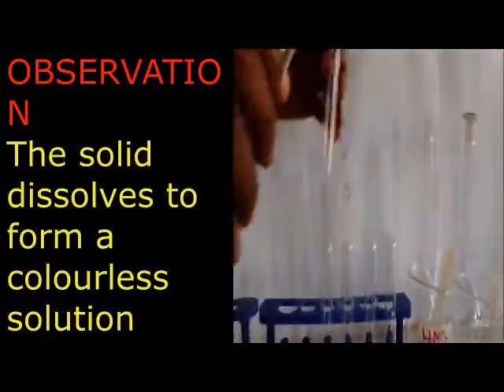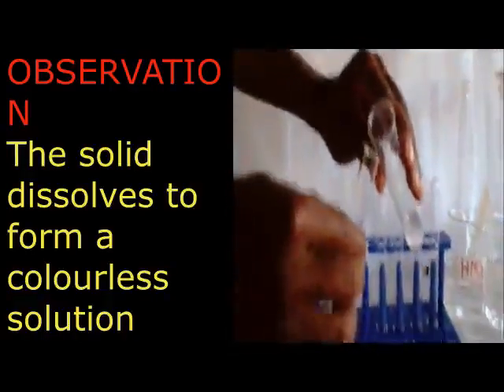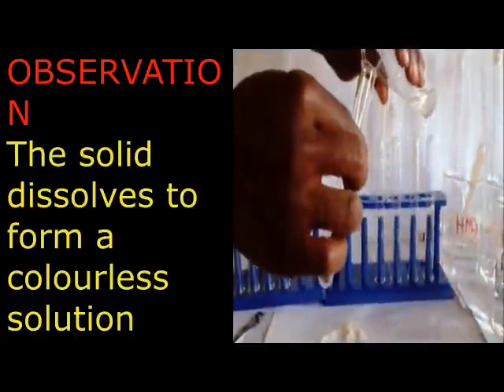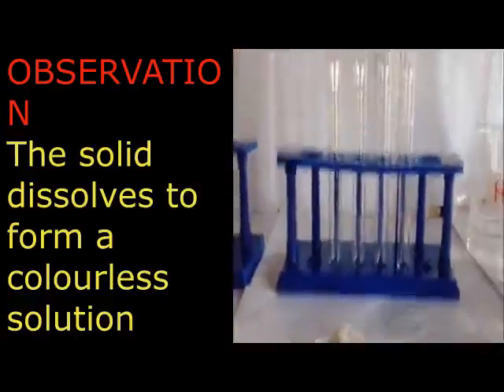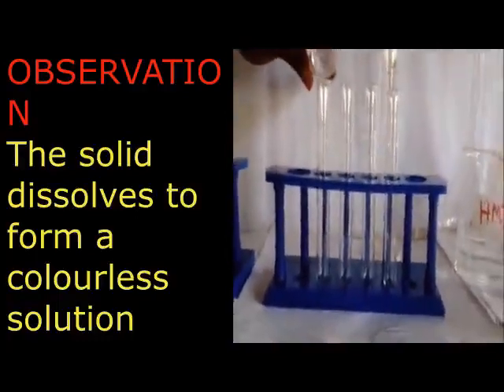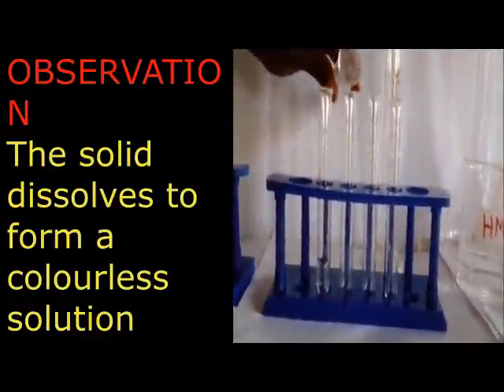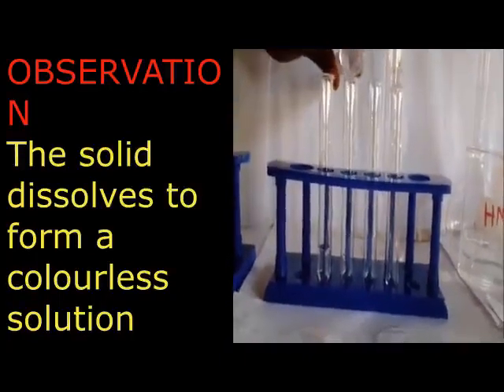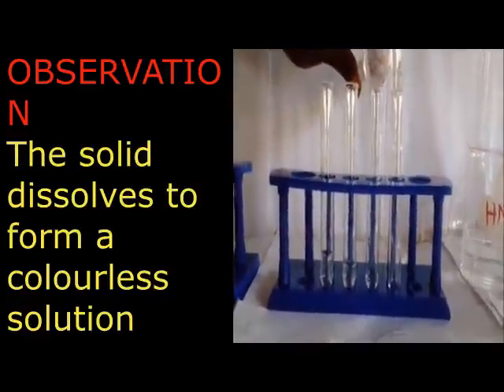At that point, you have to tell the teacher, because he is waiting to see that the white crystalline solid dissolves in water to form a colorless solution. You can see that one is going to earn your marks. Then the conclusion, which we are going to talk about on the other side, is going to be based on the salts which are soluble.